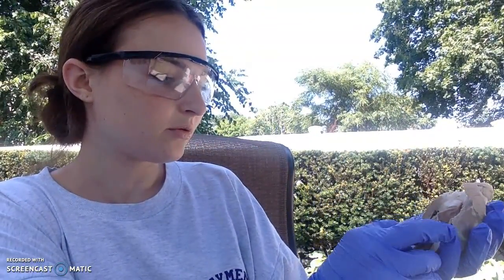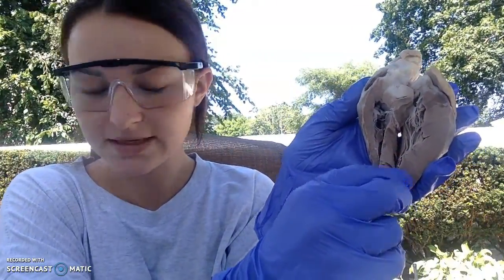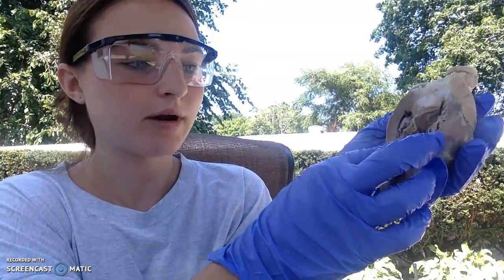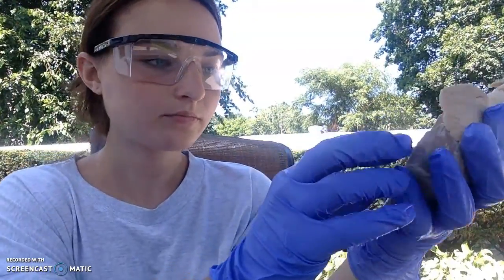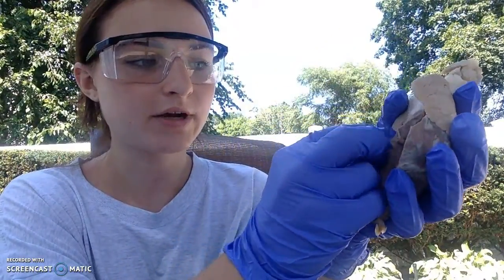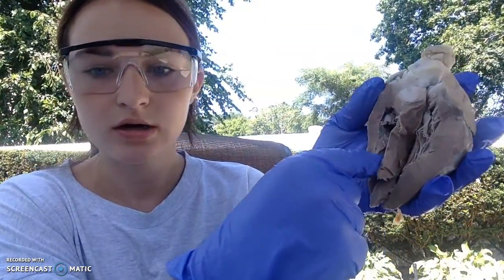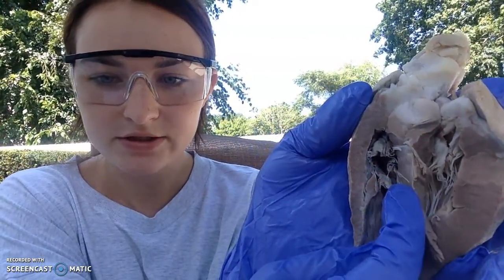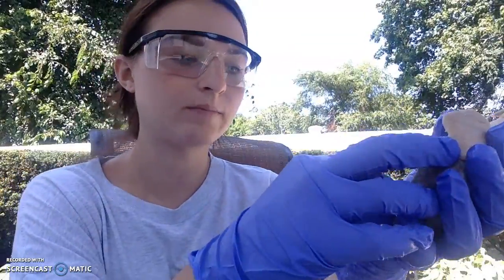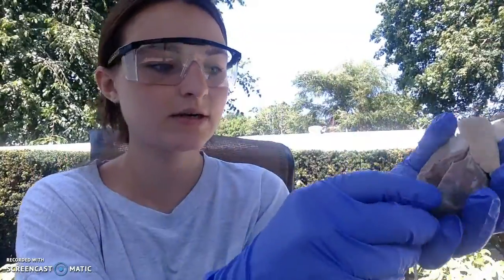As a better view, this is the interventricular septum, which separates the right ventricle from the left ventricle. And up here, in this region, we have the right atrium, and here is the tricuspid valve between the right ventricle and the right atrium. Now these little fibrous lines, these are chordae tendineae, which allow the proper functioning of the valves, so it allows them to open when necessary and close when necessary.